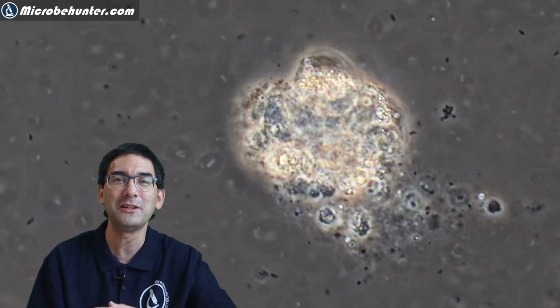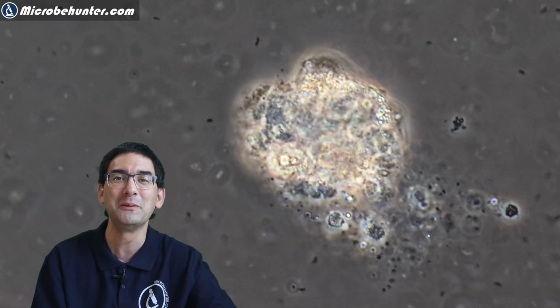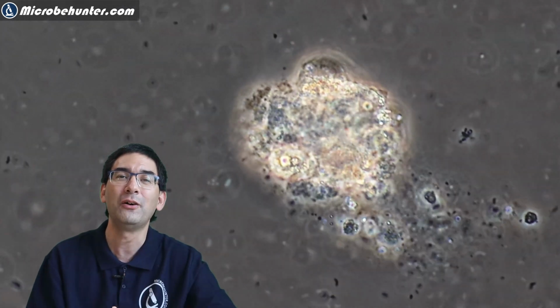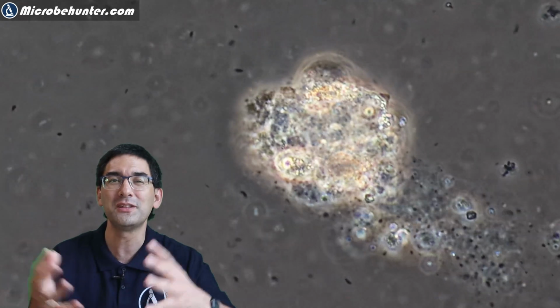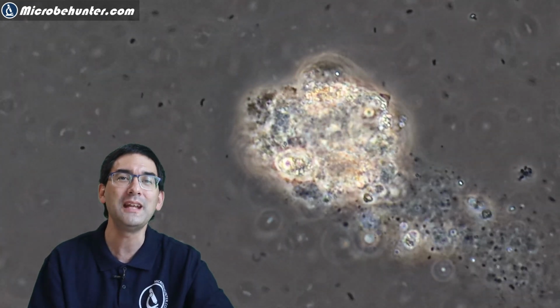And in nature, everything is recycled, and therefore, of course, the bacteria that can be found in the surrounding medium absolutely love to feed now on the debris and on the cell contents, and they will break that down and they will recycle everything. So you see, nothing is wasted in nature.